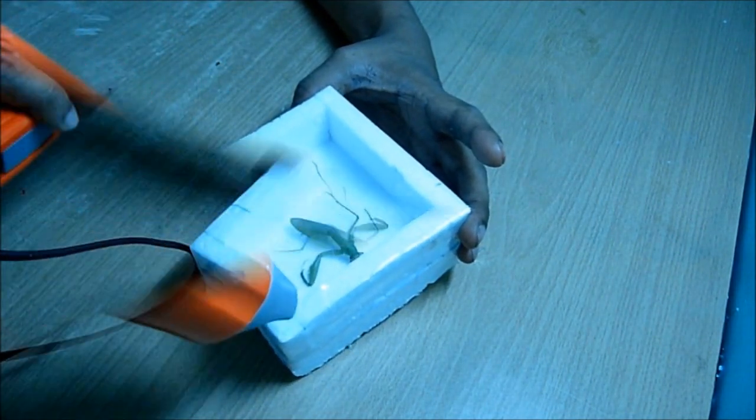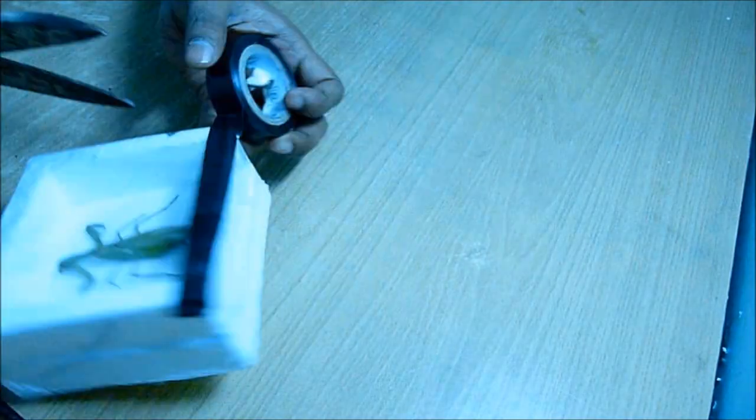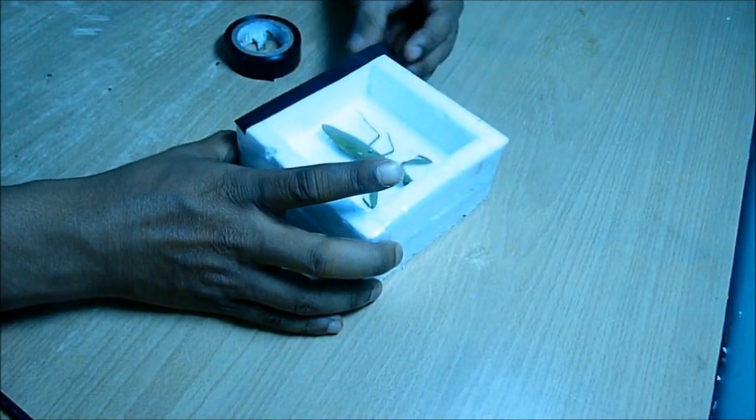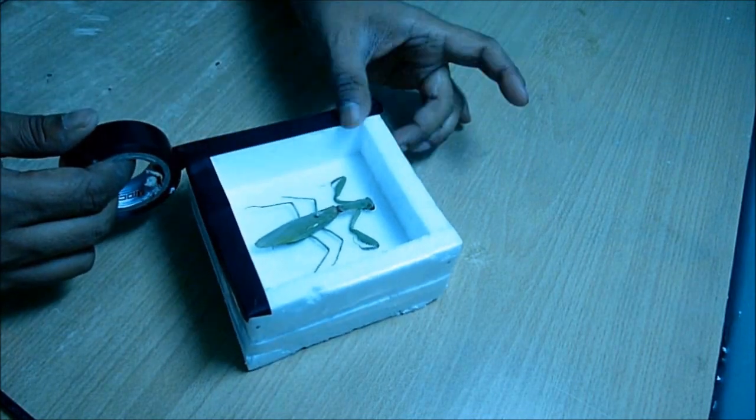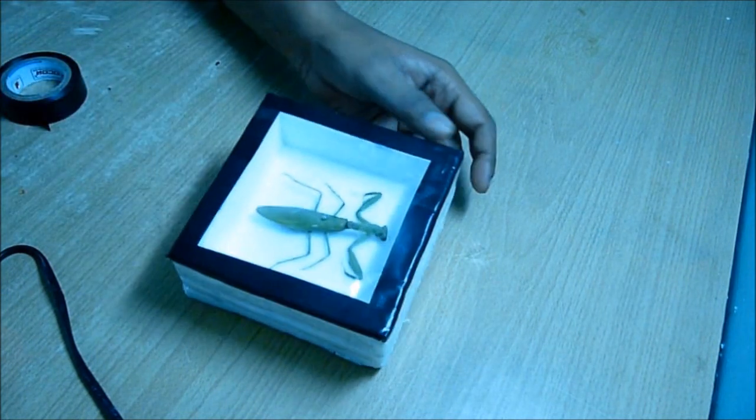And then I used some black tape to make a border around it. Now this is how the final look appears.